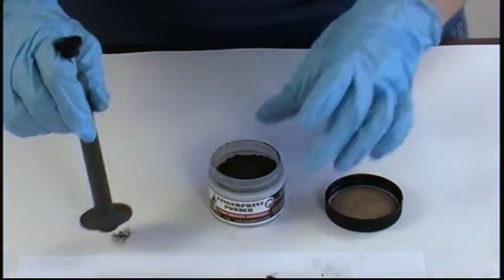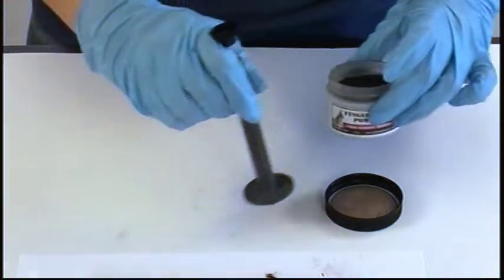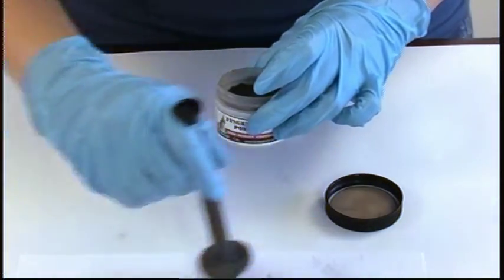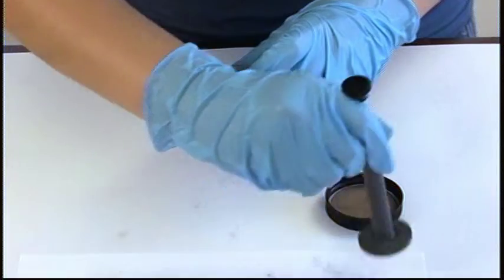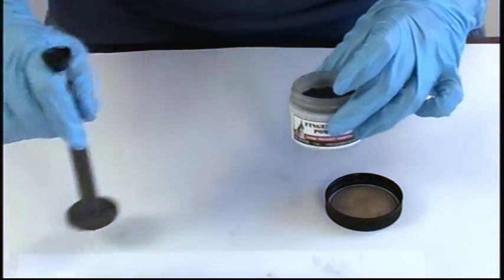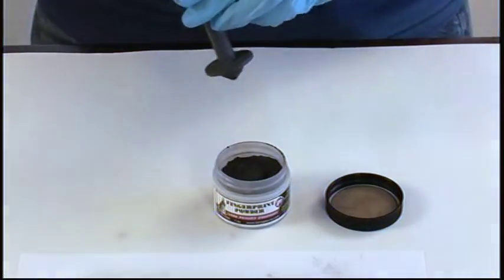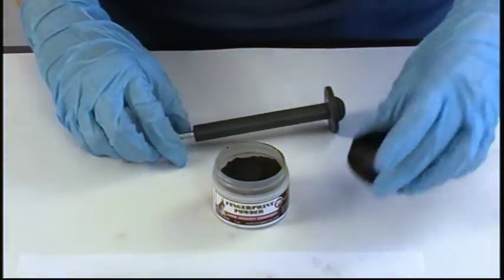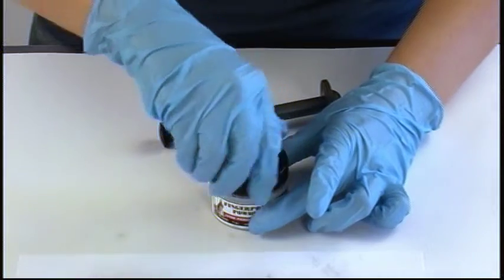Now we can depress it again and clean up any mess we've made here. Get this extra off the surface we've developed. Make sure we don't have any big chunks lying around. Go ahead and empty that right back in. There's no mess, no waste.